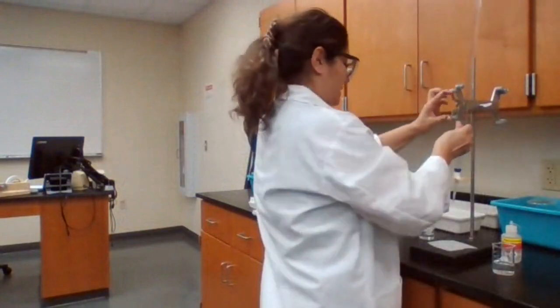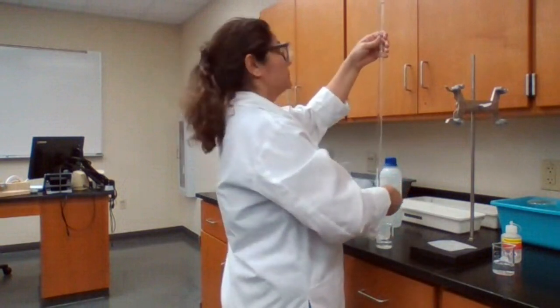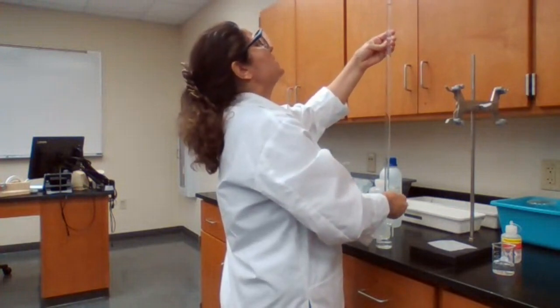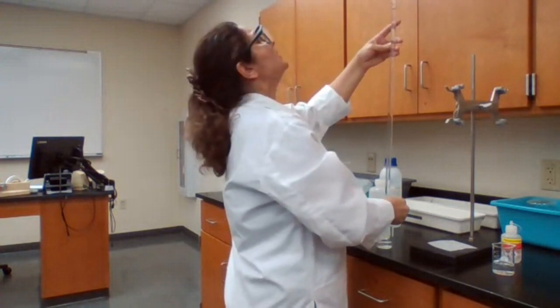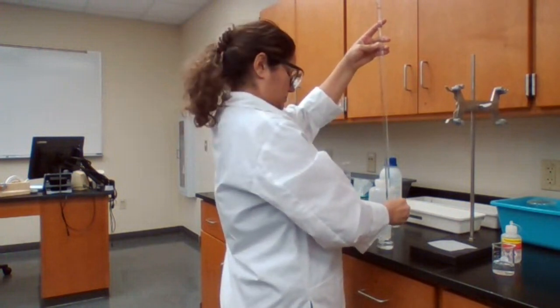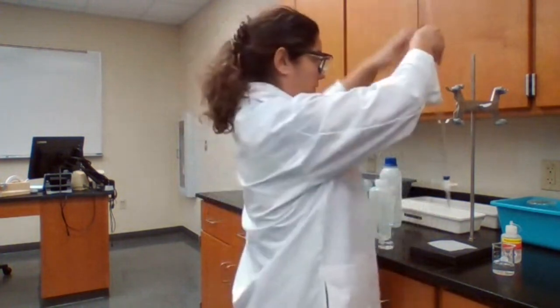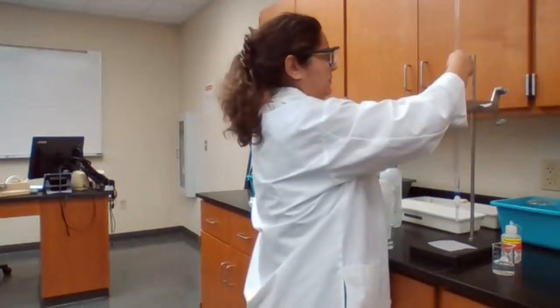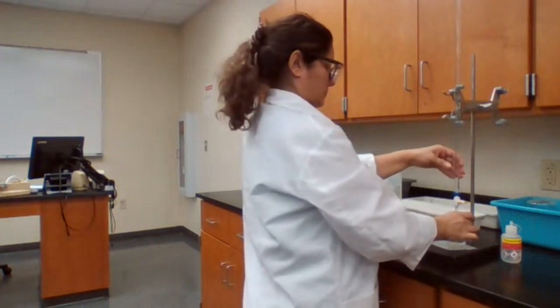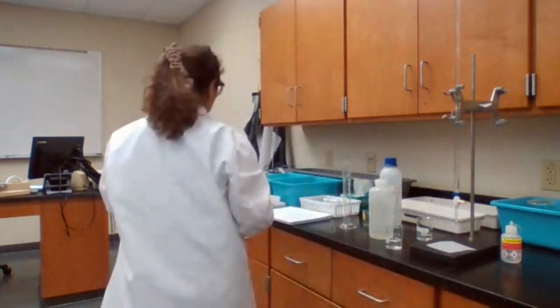And I adjust this exactly at 0. Maybe I bring it to 10 so I can see it better. That's it. That's one.